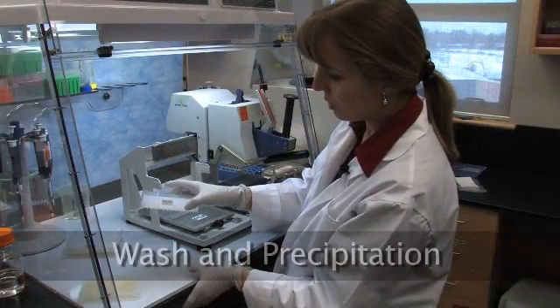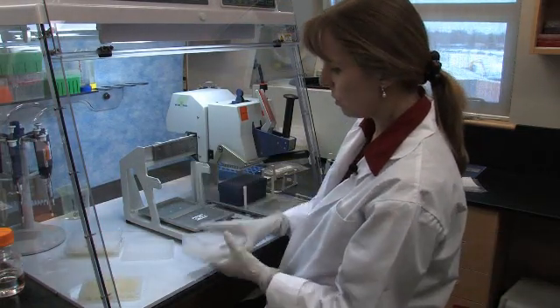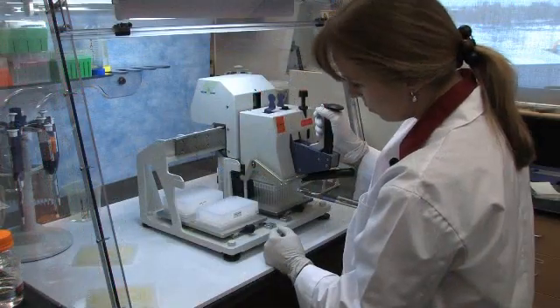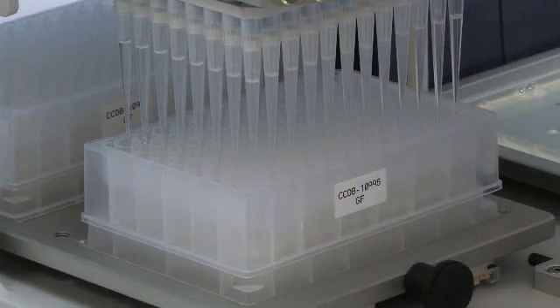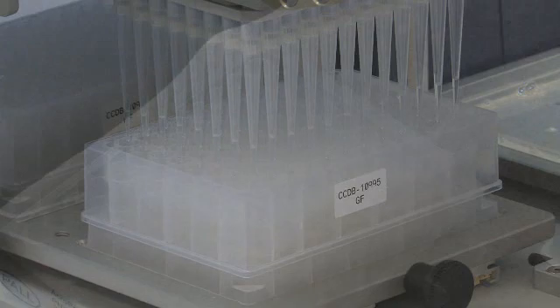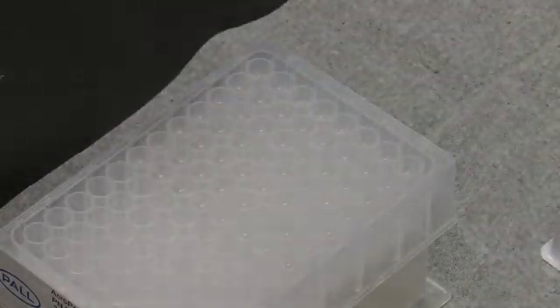DNA binding is followed by two wash steps. First, the DNA extraction plate is placed on a fresh support plate to collect the protein wash buffer. Without touching the membrane, which could damage it, 180 microliters of protein wash buffer is then dispensed to the glass fiber plate. A multi-channel pipette can also be used to perform some of the liquid handling steps.